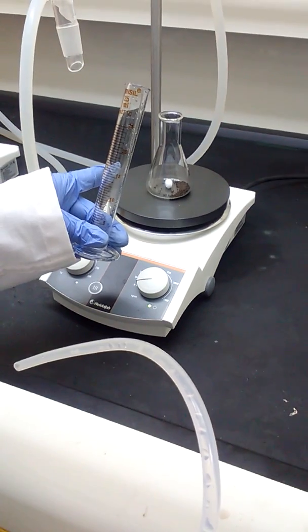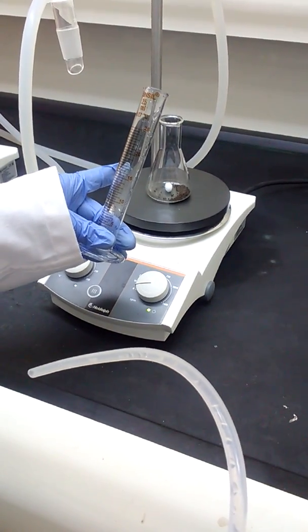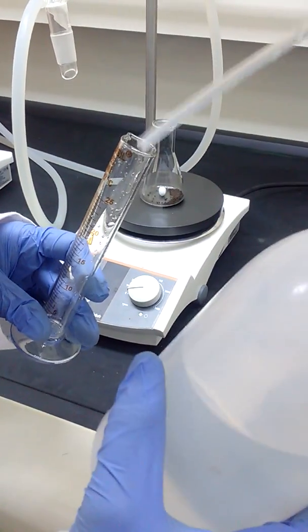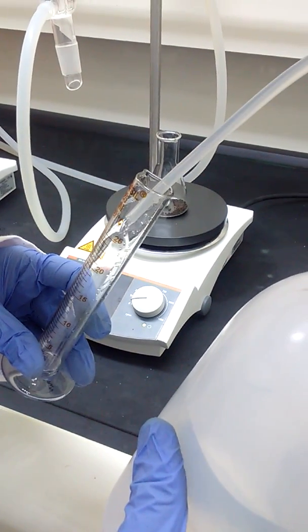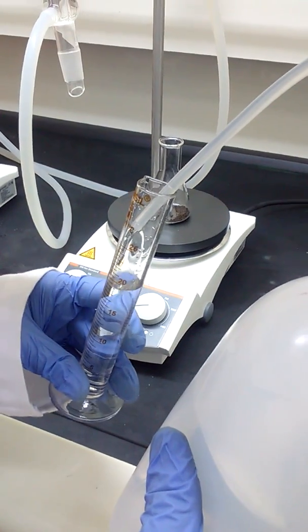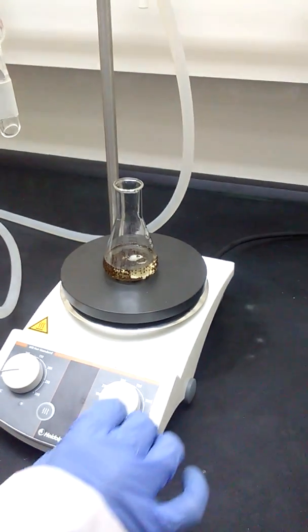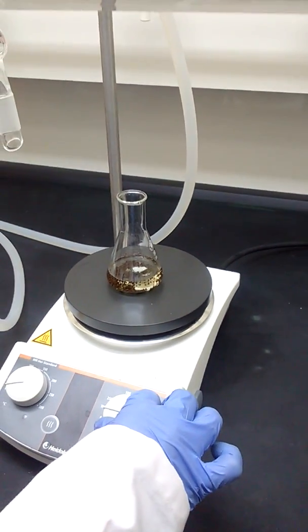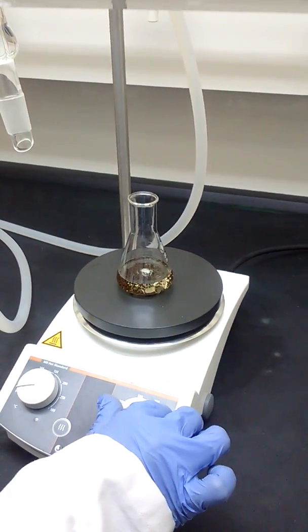To this, add 24 ml of deionized water. Stir the solution vigorously for up to 15 minutes.